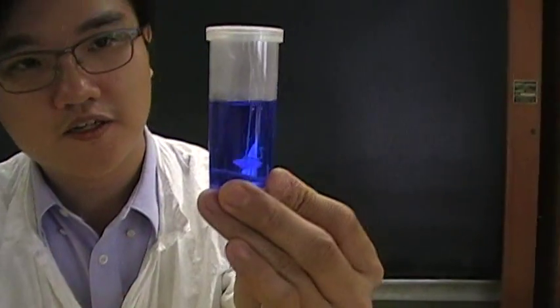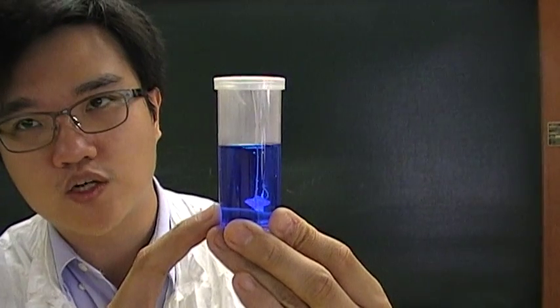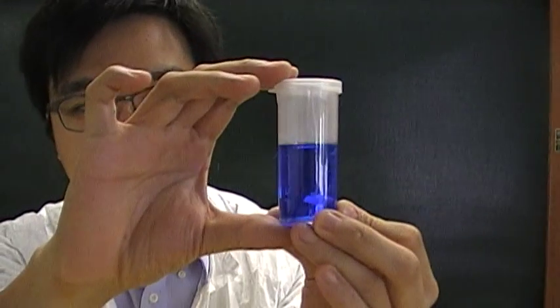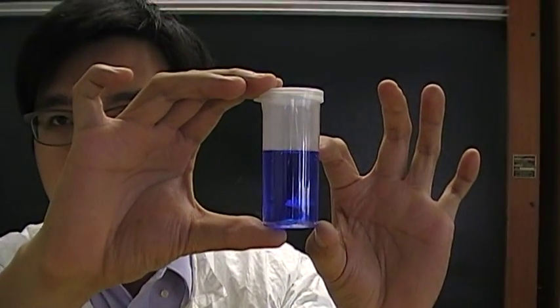See? The crystal is now suspended into the saturated solution. The saturated solution will then cool down.